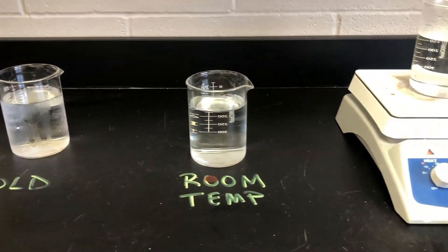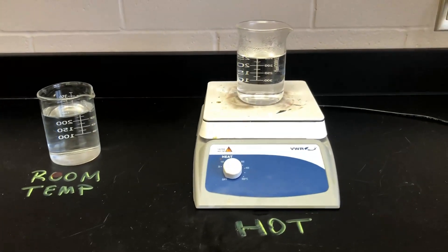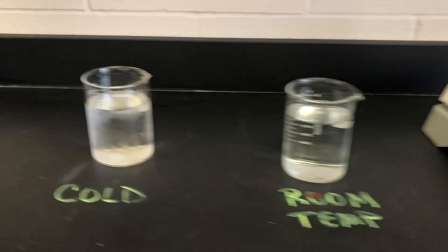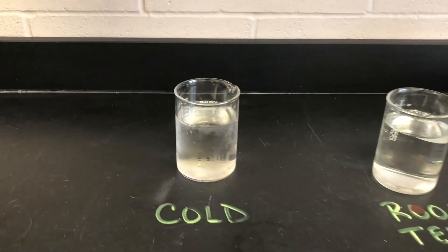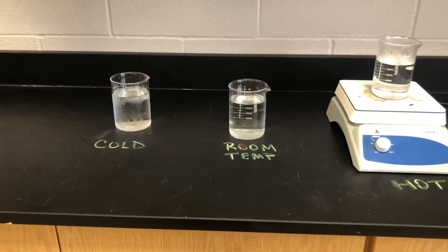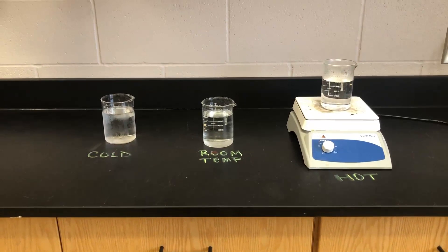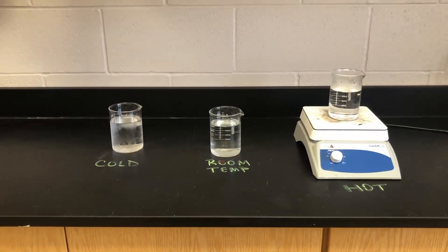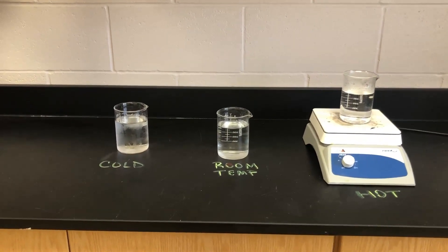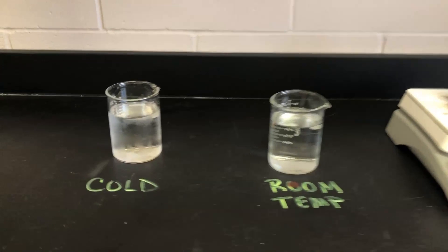We've got cold water, room temperature water, and hot water. In order to observe what's happening at the particle level, I'm going to add one drop of food coloring into each of these beakers, and I'm going to have you observe what is happening between the three.